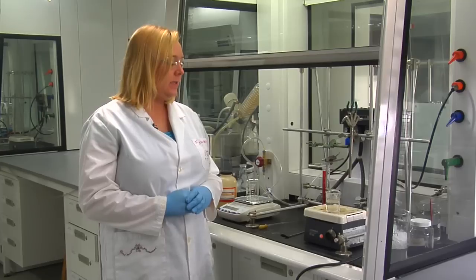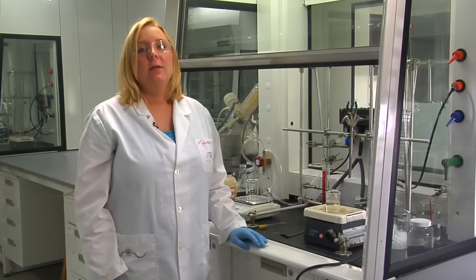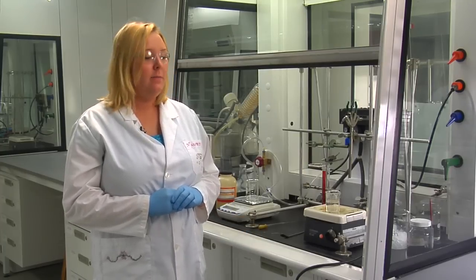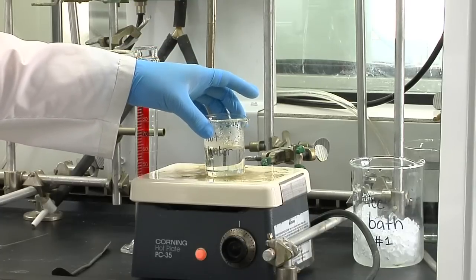Before you get started, the first thing you want to do is get some distilled water. You get this from the white tap, not the green or red ones, at the front of the lab, and put it onto your hot plate to start heating up.